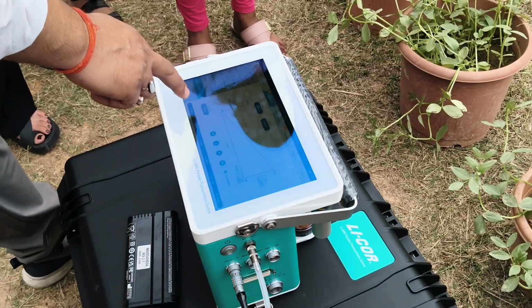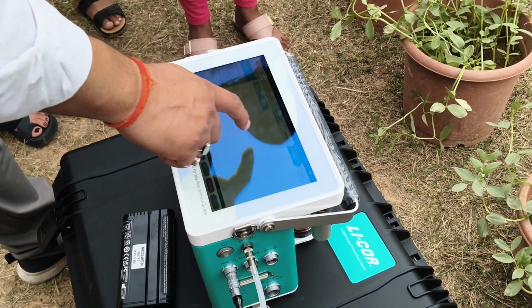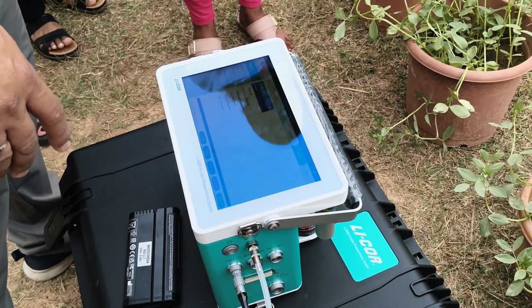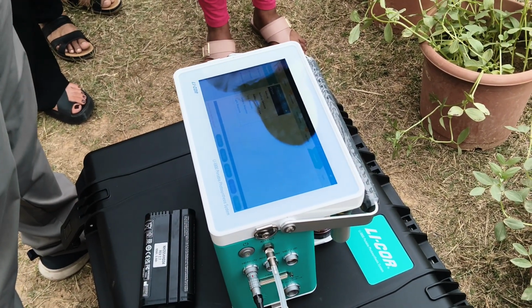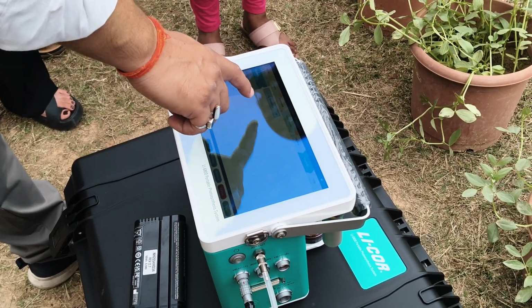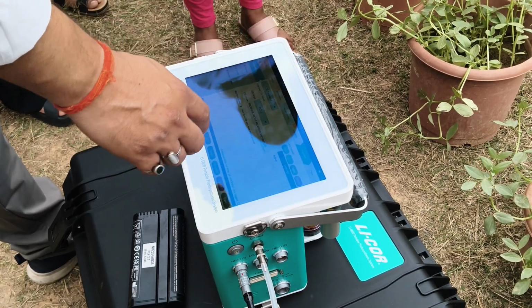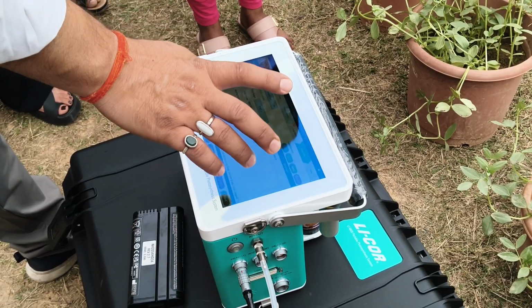Okay, and there are some auto control methods. I just tell you the programs. There are multiple programs. You need to select before starting the measurement. So there is a none method. With this none method you can do manual logging only. Then there is the CO2 response curve. In this you can put some range and in that particular range it can stabilize the equipment, and you will get the photosensitivity and other parameters in that particular range.